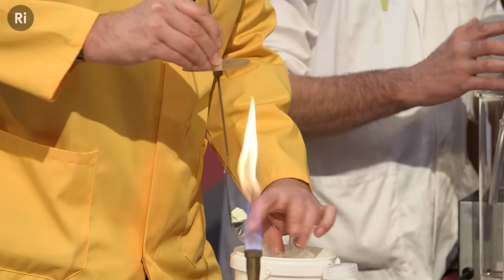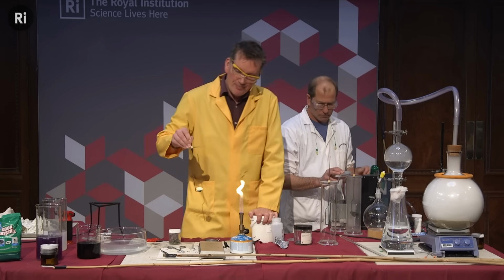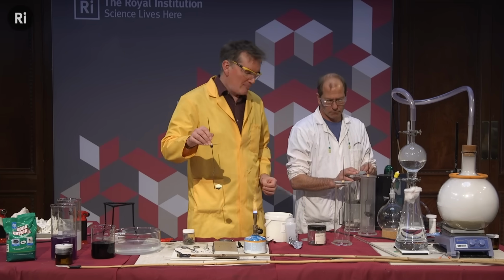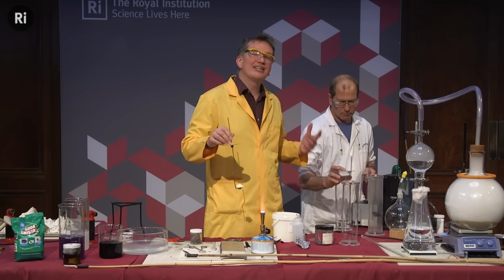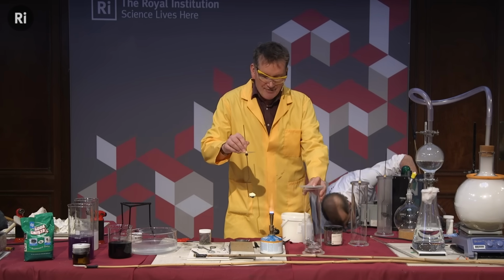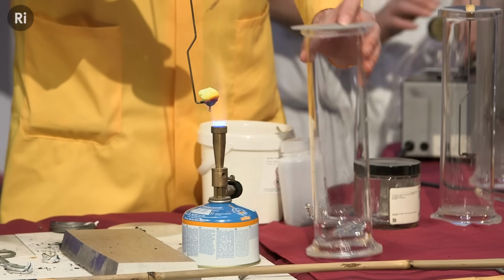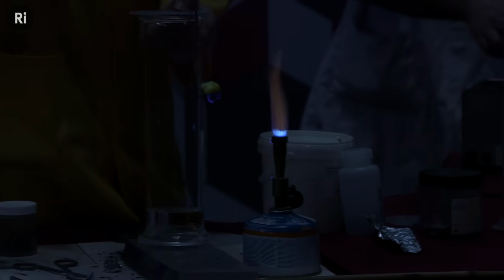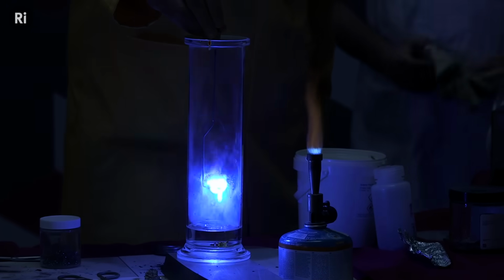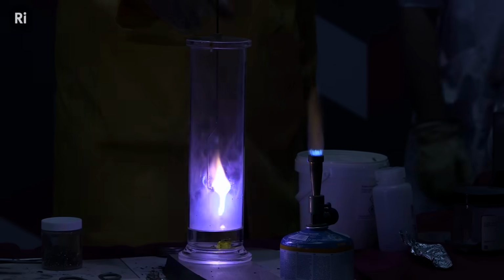Now, an old name for sulfur, in fact the name that occurs in the Bible, is brimstone. This is because you can find lumps of it lying around, especially near volcanoes, so it's thought to be a mineral. But the name brimstone means burning stone, or the stone that burns. So if I just start this to react with the oxygen there, and again, if we can have the lights down perhaps for this. So I think it's now going. If I lower this in, we get a fantastic blue light as the sulfur is burning. That's rather nice.